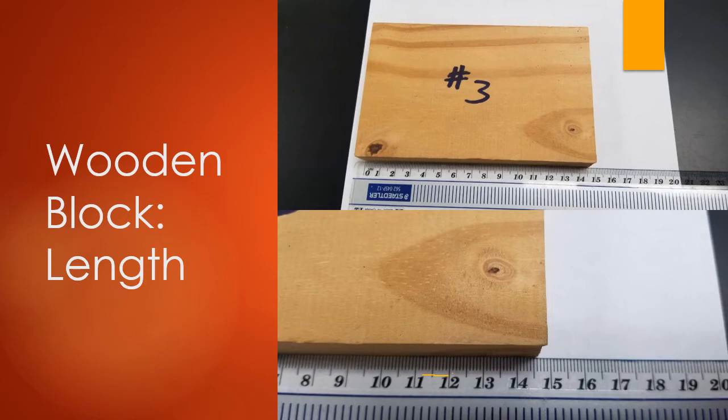I'd say it's halfway between 14.5 and 14.6. So the measurement I would write would be 14.55. Now you might have written 14.54 or 14.57. That's fine. What's important is that you are keeping the correct number of significant figures.